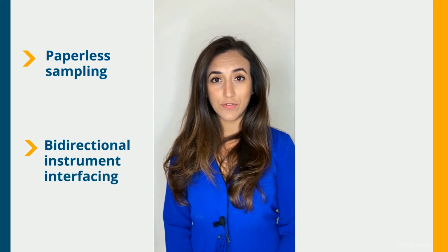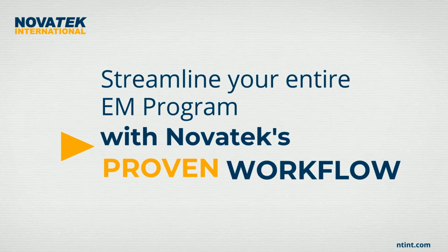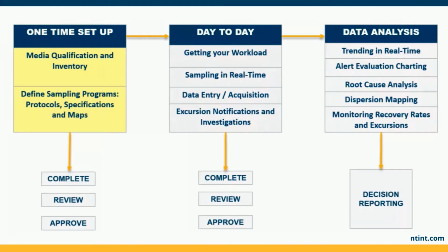Novatek's environmental monitoring solution brings the latest technology for paperless sampling, bidirectional instrument interfacing, trending, and root cause analysis. Novatek's EM solution streamlines your entire EM program from a one-time setup of your sampling plan, including facility maps, to day-to-day sampling paperlessly in real time, including data acquisition and entry, as well as the critical data analysis for recovery rate reports and root cause analysis for incidents and excursions.